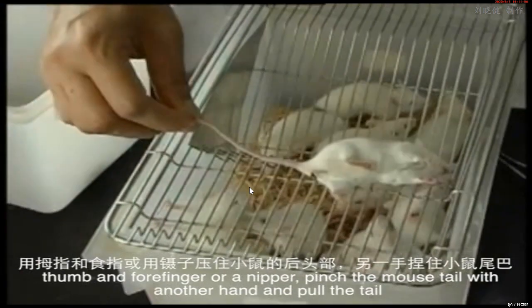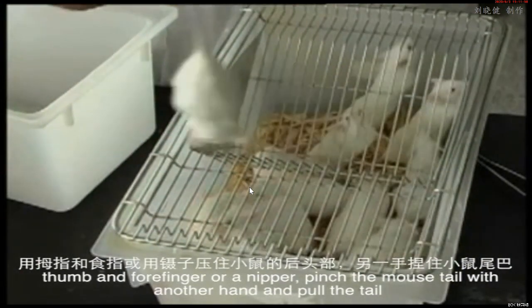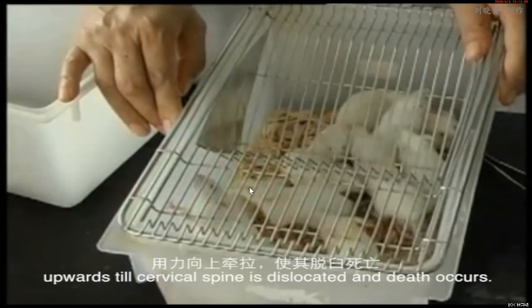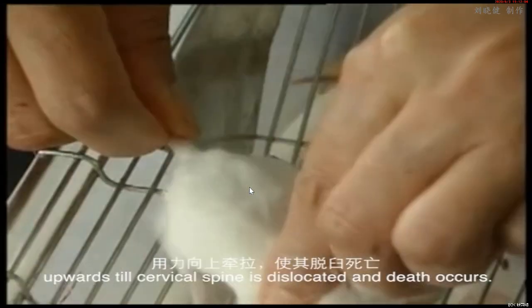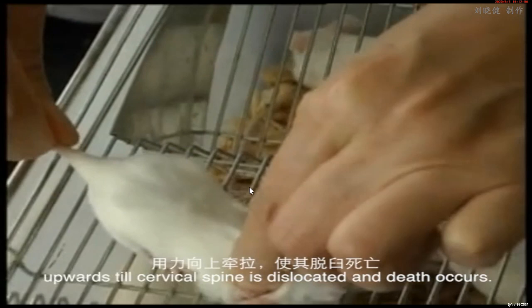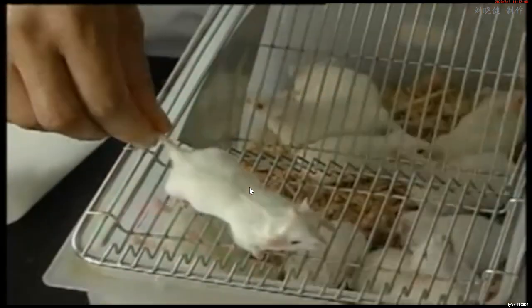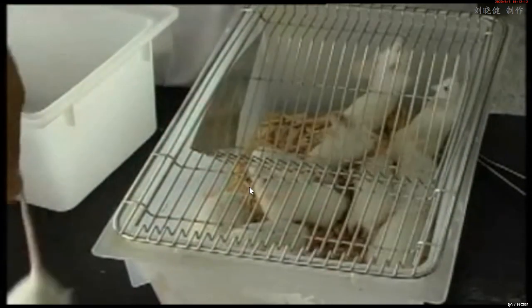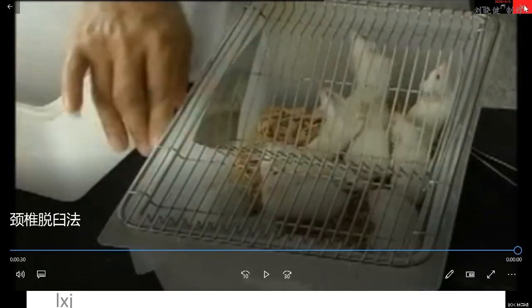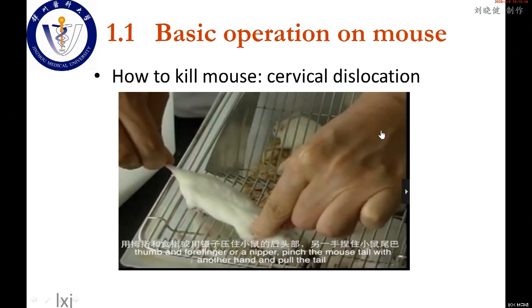Pinch the mouse tail with the other hand, and pull the tail upwards until the cervical spine is dislocated, and death occurs. Okay, this is the first part.